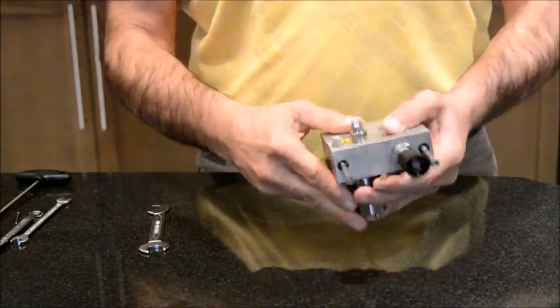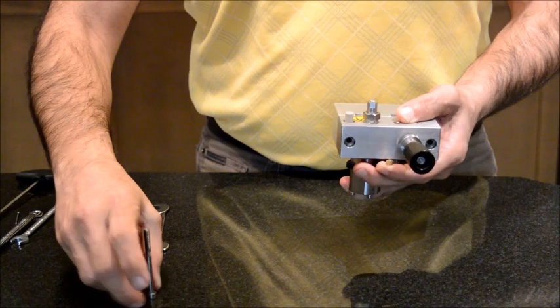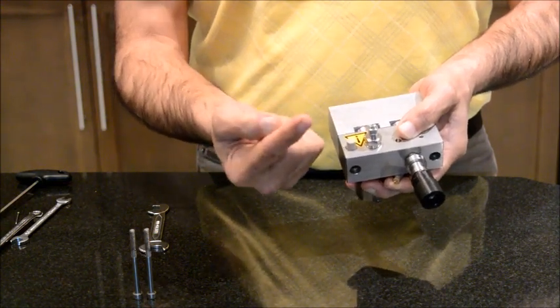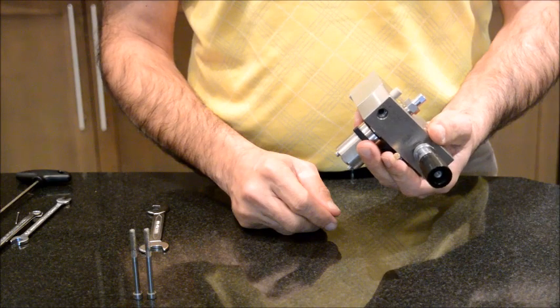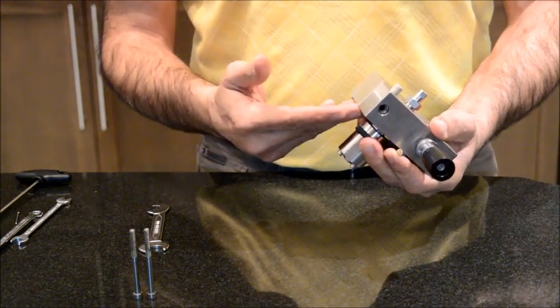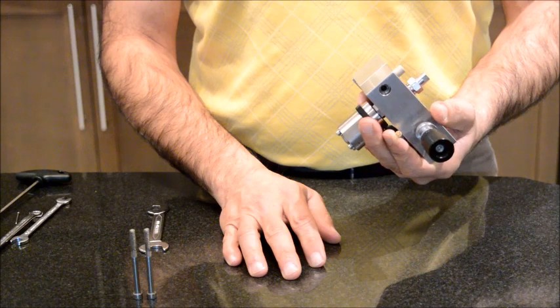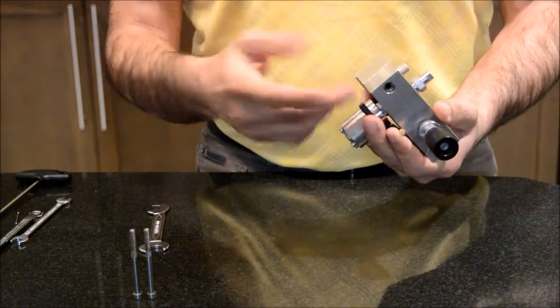The other component that we see on the top, I'm going to remove these screws. The other unit that we see on the top is a passive outlet valve. What it does is that it allows the mobile phase to leave the pump head, but prevents it from coming back to the pump head due to the back pressure. Now, the problem that you may see during your HPLC run that relates to these two components is that, let's say your HPLC pump is working, but there is no flow into the system. Or if there is a flow, the flow somehow fluctuates. I will show you later during this video how we can remove these two components and fix it.